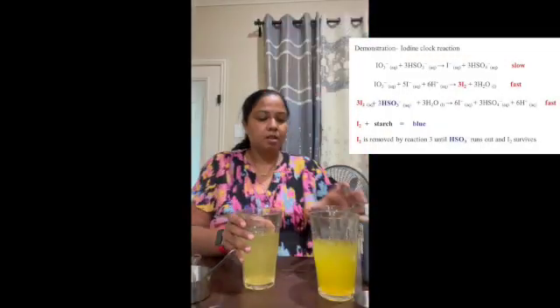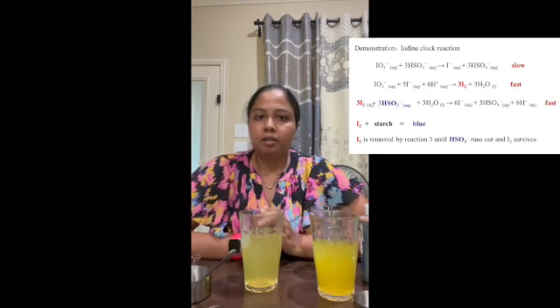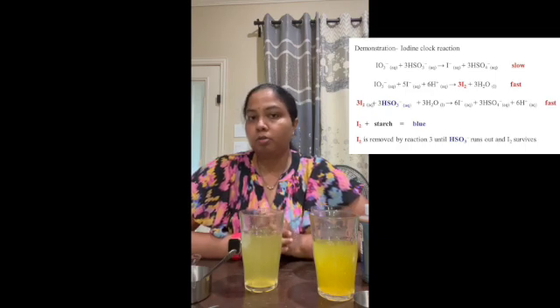Meanwhile, I will explain the science behind it. Our solution A contains vitamin C and iodine. Vitamin C reacts with iodine and reduces it to I minus ion, and hydrogen peroxide tends to react with iodide ions to form iodine.